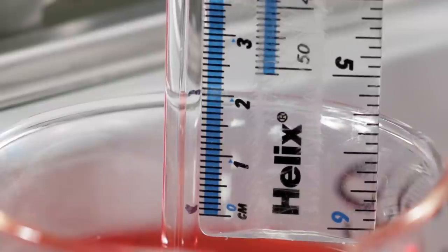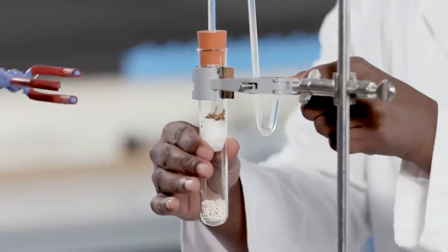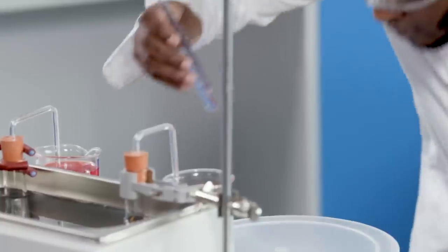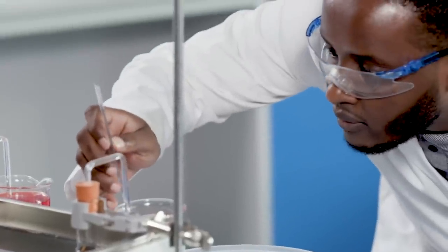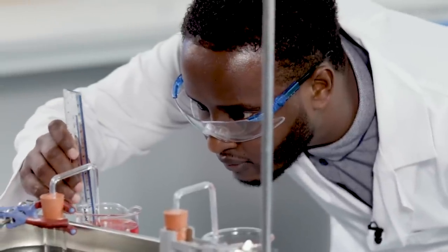Repeat the experiment at different temperatures and make sure you use the same number of organisms each time. Use your knowledge of aerobic respiration to help explain the data you have obtained during your experiment. Your teacher may give you further questions to extend your understanding and the technique shown within this practical.